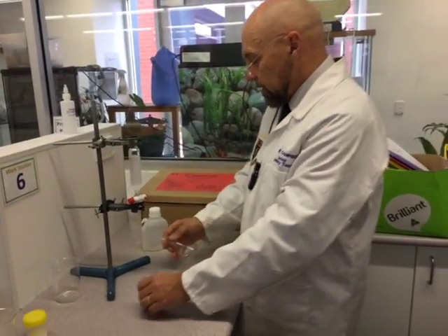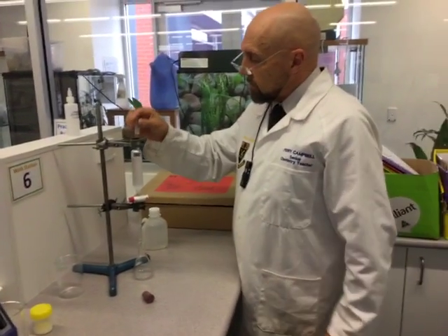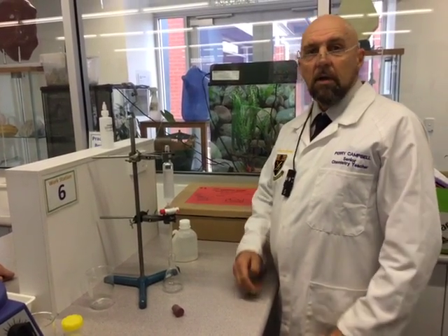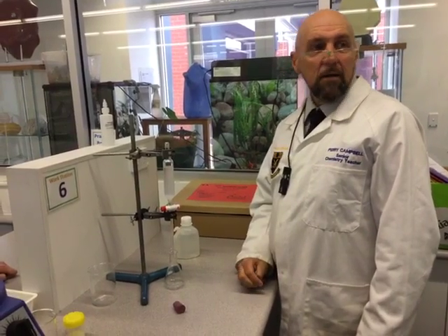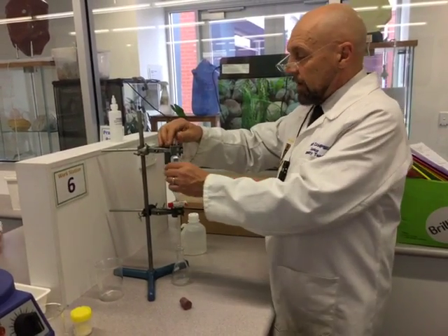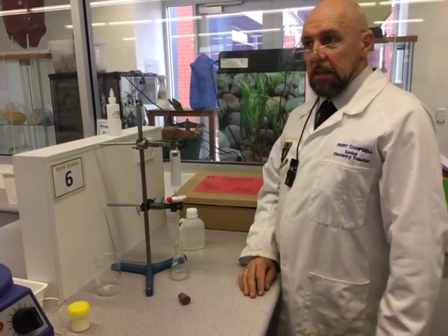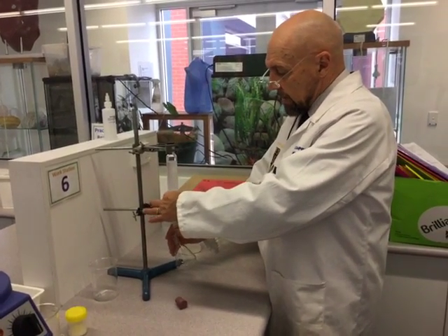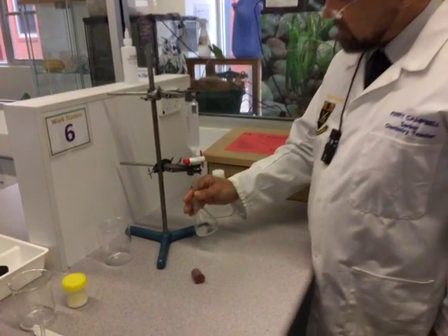The last step now — the other thing I forgot to say is that some people do this — that's a big no-no. It just means when they turn the tap on they wonder why it doesn't actually empty out, because you've created a vacuum. So don't come and ask me why you can't get it to work. Just make sure the stopper's not in there when you're obviously separating out the layers. Now this is going to go straight into my conical flask.